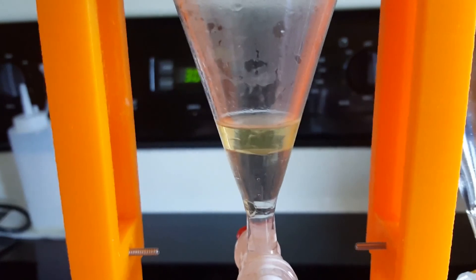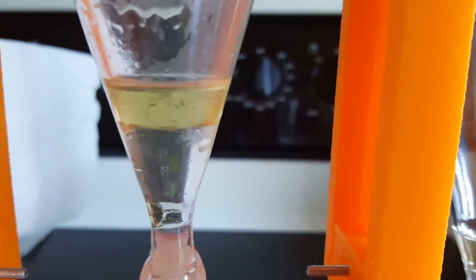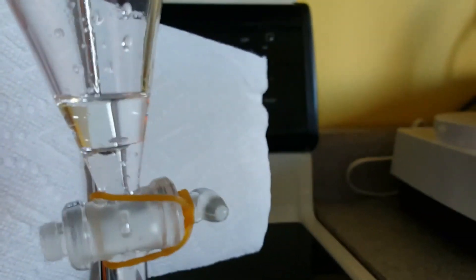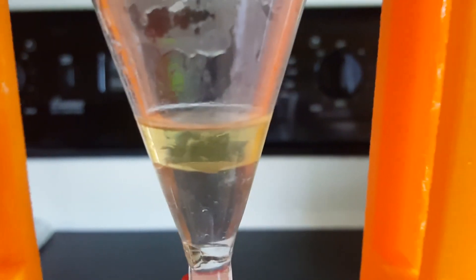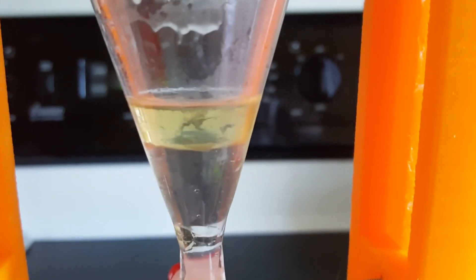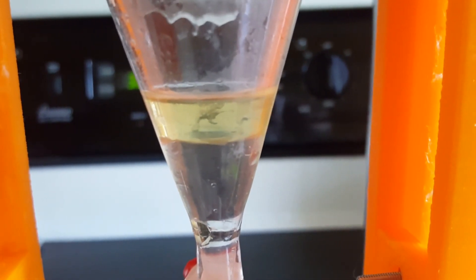As I'm disassembling my distillation apparatus I'm comparing the two batches of my distillation. This is the first batch and as you can clearly see it has a yellowish color. This is the new batch and it's also clear to see that it's transparent pure white. I'm wondering where the difference in the color is because the first batch was burnt a little bit.